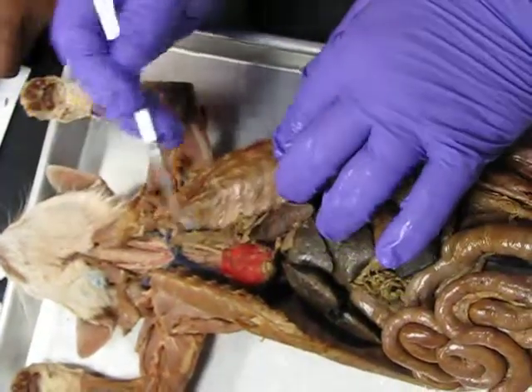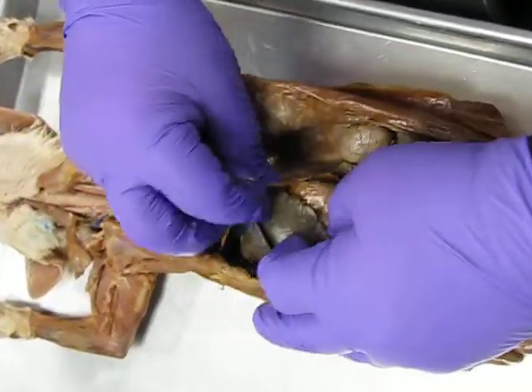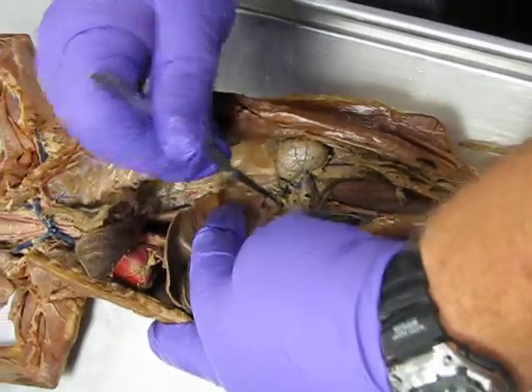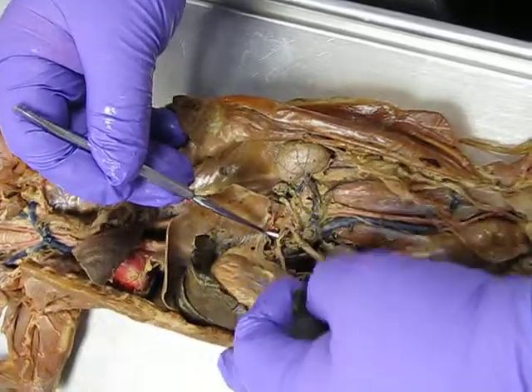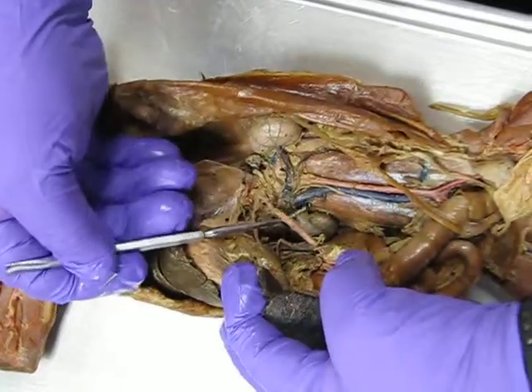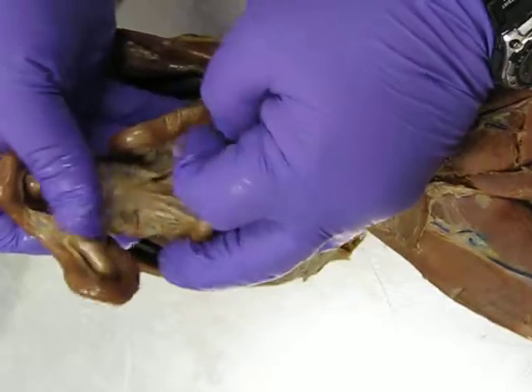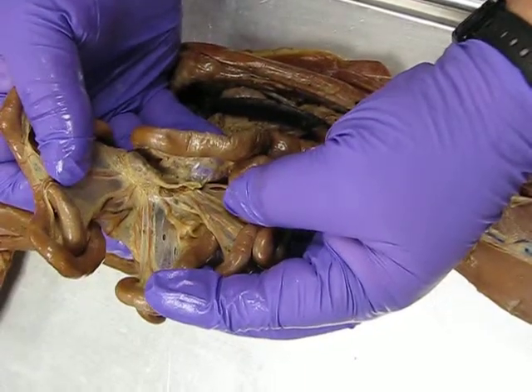Okay? Now, that aorta passes down through the diaphragm. And that's the diaphragm. See that diaphragm? That's the diaphragm. The aorta passes through it right there. See where it comes through? The first branch that it gives off is the celiac, and it goes to the stomach. The second branch that it gives off is the superior mesenteric, and it goes to the mesentery. And this is the mesentery. See all of this? So that superior mesenteric is all of those blood vessels going out to those intestines.